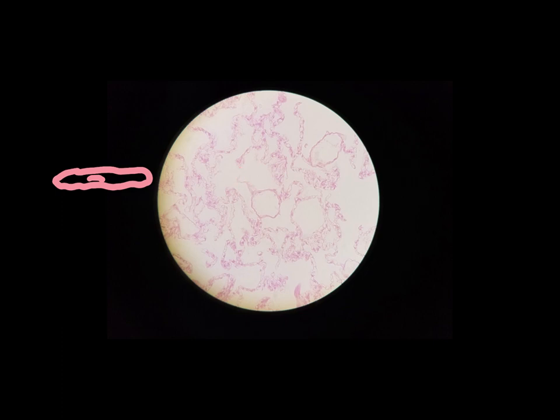If we look on here where we see really good evidence of simple squamous epithelium, but scattered here and there, you'll see cells that are not so flat and the nucleus is pretty round. That's what I was just talking about. Here and there, you will see some tissues on this slide that are not simple squamous epithelium. But most of the cells that we see on this slide are very, very flat, and the nucleus is kind of elongated. So they are simple squamous epithelium.